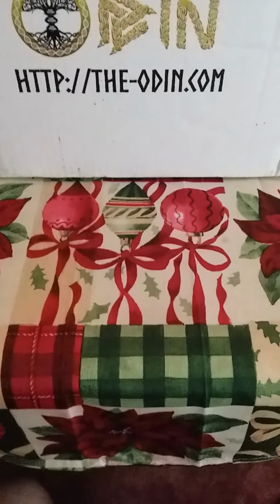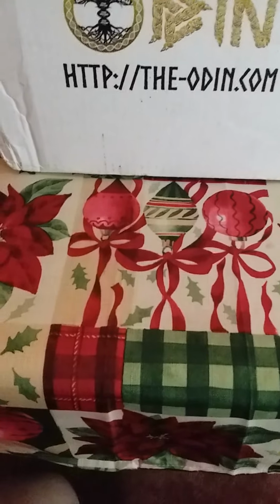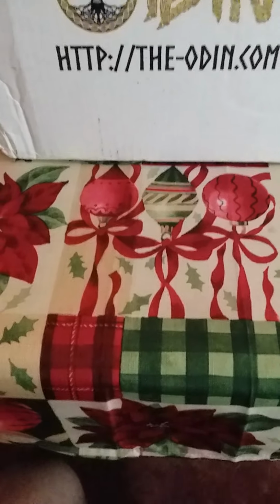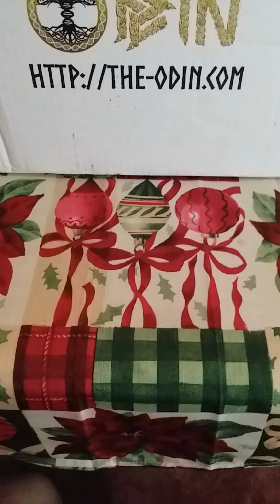Today is July 4th and this is part 2 of the experiment cultures in the course Bioengineering 101 week 2.